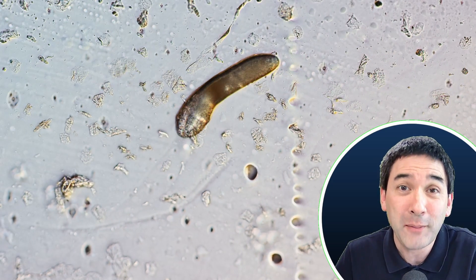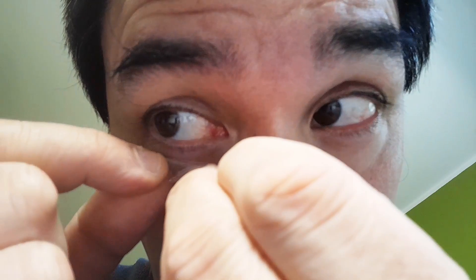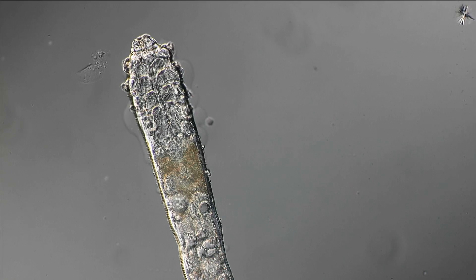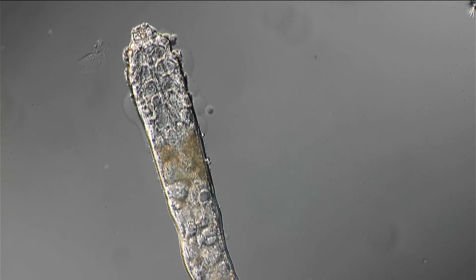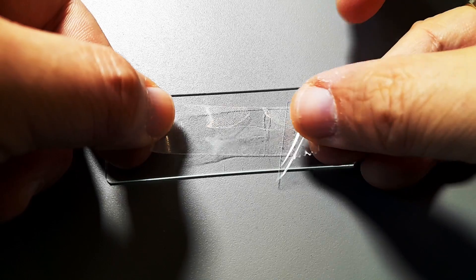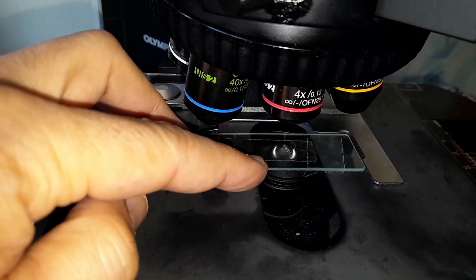If you would like to observe them under the microscope, what do you have to do? Quite easy. You have to first squeeze them out of the hair follicles. You do that by carefully grabbing your eyelashes and pulling on them — don't rip them out, but carefully pull and rotate the eyelashes. You can do that with your fingers or with tweezers. I've got very flat tweezers which allow you to hold those eyelashes better. If you do that for a couple of seconds, the facemites will be squeezed out of their hair follicles. You then take a little bit of sticky tape — regular scotch tape — and press it against your eyelashes, making sure you have good contact. Then any facemites that have been squeezed out will be on the sticky tape. You stick and glue the tape with the sticky surface on top on a microscope slide, and you simply put it under the microscope and look for them.